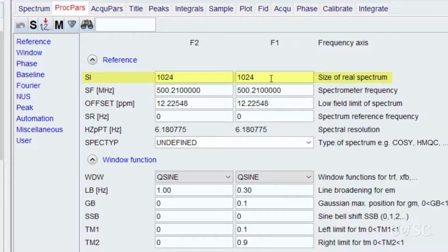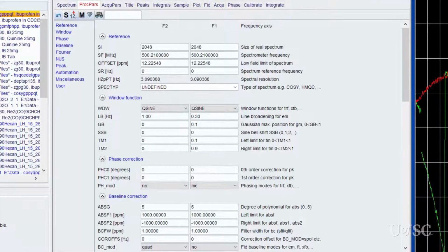By default, the T1 processing is increasing the number of points from the collected 128 to 1024. This is called zero filling since no new data is added to the processing, just blank points. The resulting F1 dimension will not have any added resolution, but the results will appear smoother or less jagged. We should increase the size of the T2 transformation points to at least 2048 to preserve the resolution of the collected dataset. You can either leave the T1 size at 1024 or increase it to 2048.